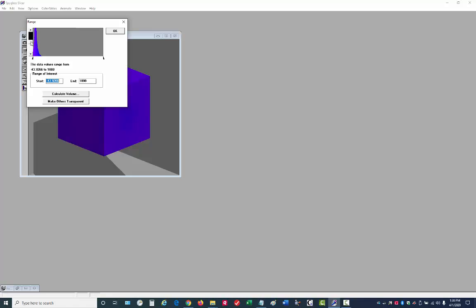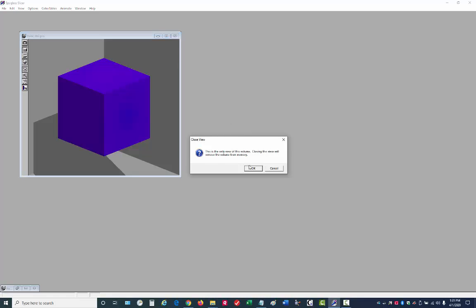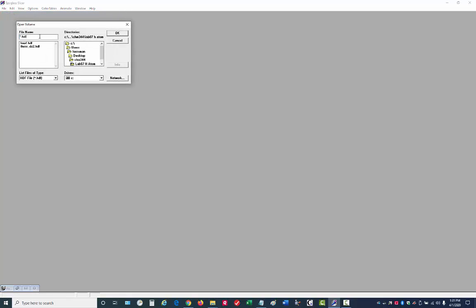In other words, if I bring this back, I can see the data really only goes between, let's say, -40 and +80. This is the true extent of our data. And if you have that situation, unfortunately, the only thing you can do is to go back and read the data in again, specifying those limits. So we'll go through that process now.